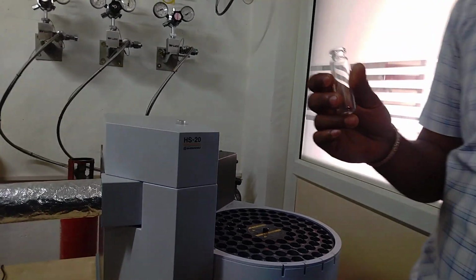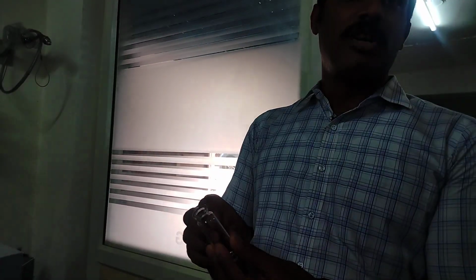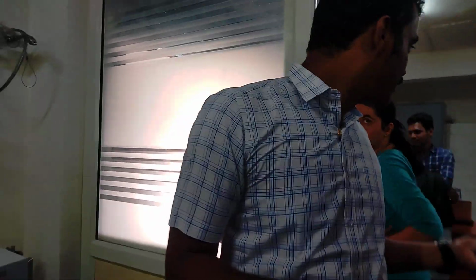In the other technique with liquid, say if you have a solid sample, you need to extract that and then filter it and then inject the complete liquid form. You have to take it into the liquid form. But here it is not like that. You can directly put the solid. Okay, that solid will be vaporized. Whatever the content there is in the solid, that will be vaporized and then taken to the instrument.